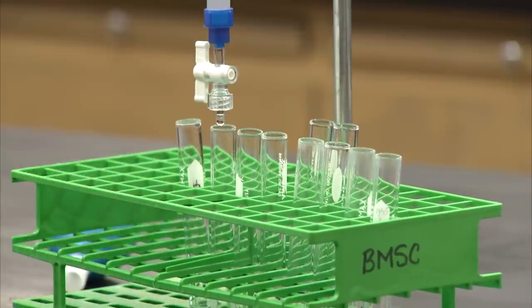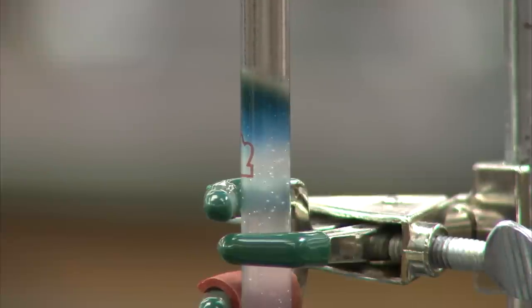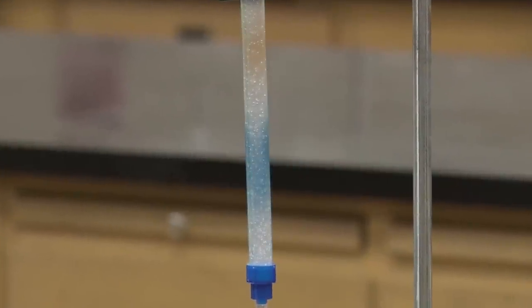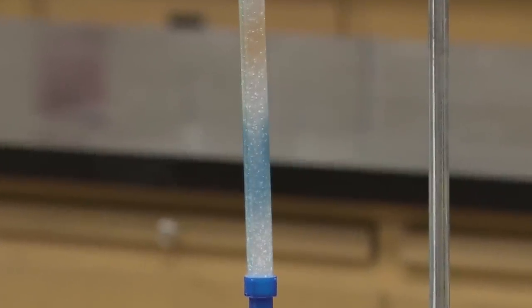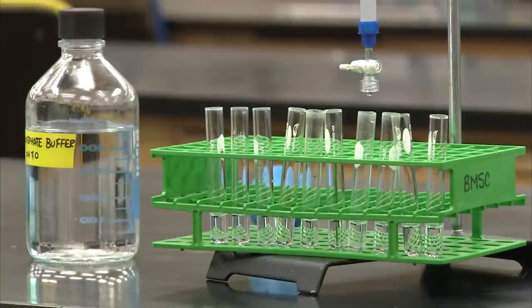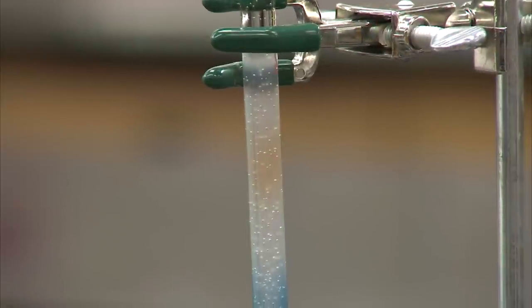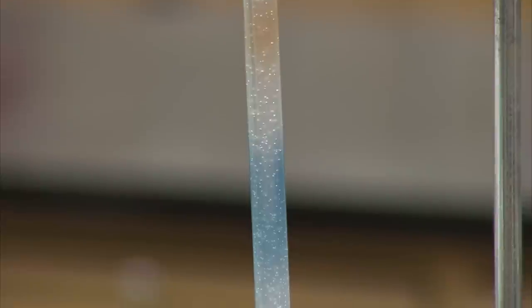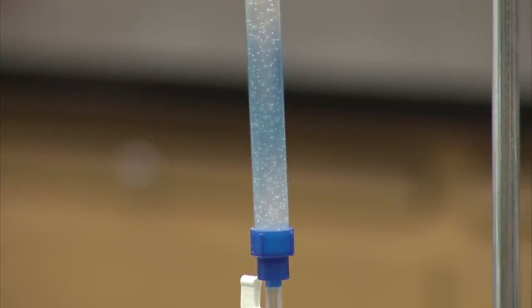As the experiment runs, you will not see any separation of proteins, but this demonstration using dyes clearly shows the blue dye has a faster mobility, and thus larger size than the red dye. While the elution can be time consuming, keep an eye on your column to make sure that it has not stalled. If it does stall, the column will not complete elution before the end of the lab period.